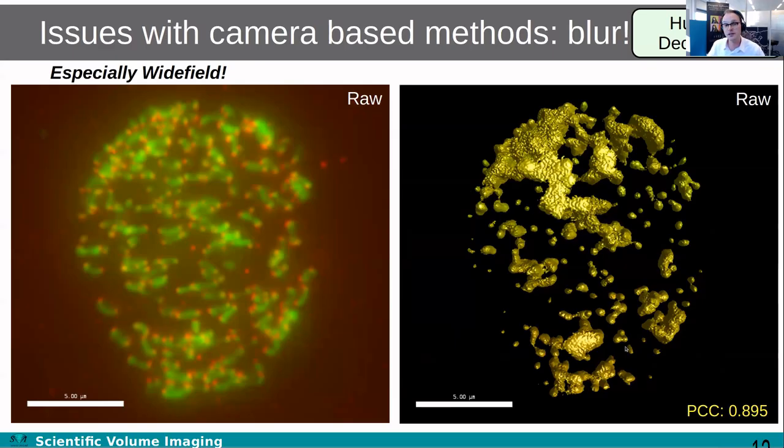Other microscopy types suffer from blur. Wide field is the most notorious, of course, for having a lot of blur, but also other camera-based methods. For example, if you have a spinning disk type microscope and your sample is a little bit thicker, you will also have blur. You may not notice it immediately, but it is there, and that will also deteriorate your image quality. For light sheet, it can happen as well, although the story is a little bit more complex there.